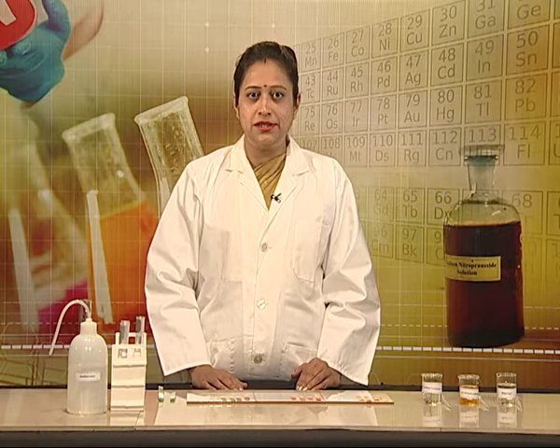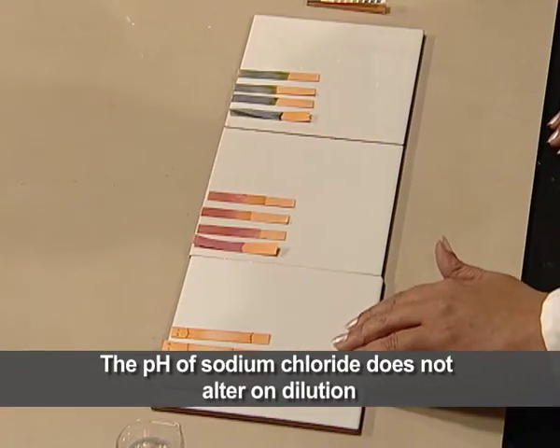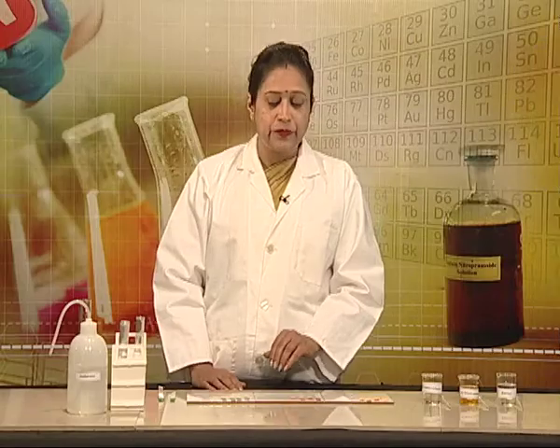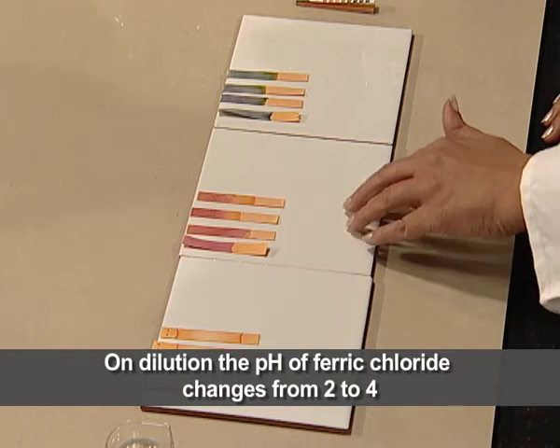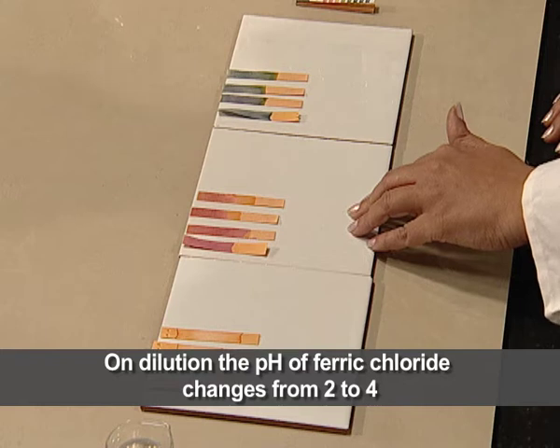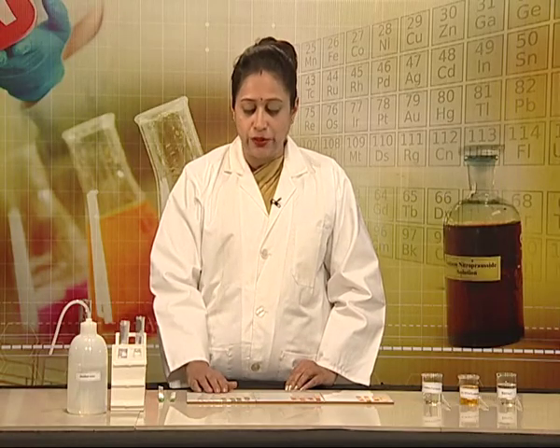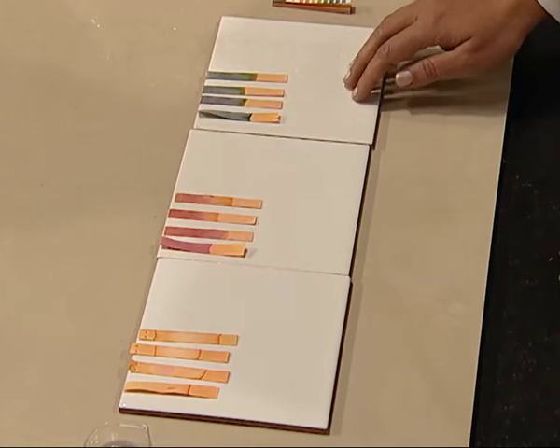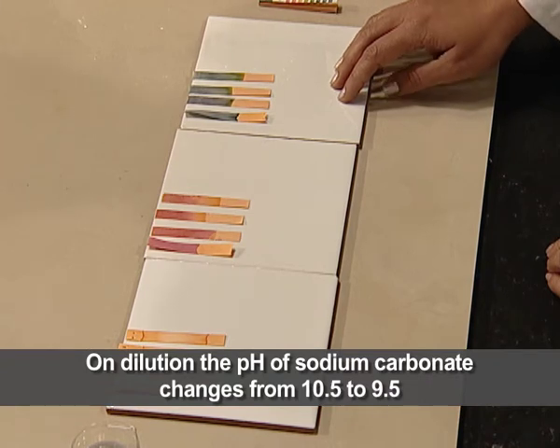Let us summarize what we have learned today. The pH of different salt solutions is different. The pH of sodium chloride does not alter on dilution, as it is a salt of a strong acid and a strong base. For ferric chloride, which is an acidic salt that may get hydrolyzed, dilution shows a change in pH from 2 to 4. For sodium carbonate, which is a basic salt being a combination of a strong base and a weak acid, dilution shows a change in pH from 10.5 to 9.5.